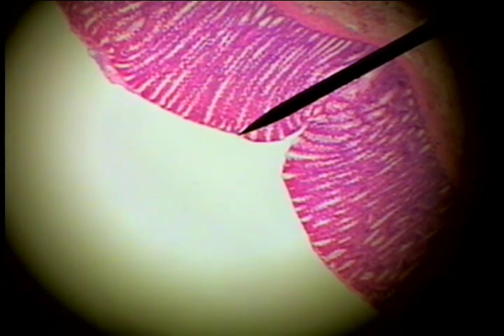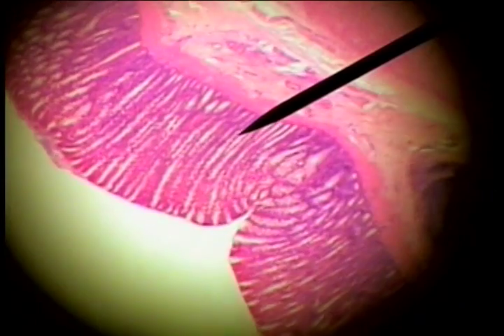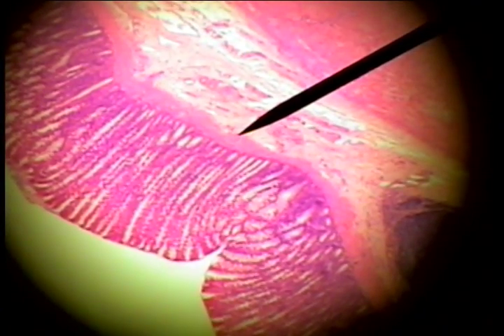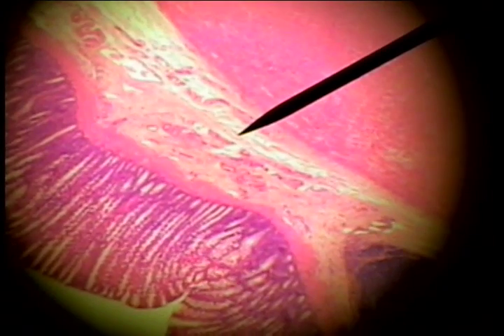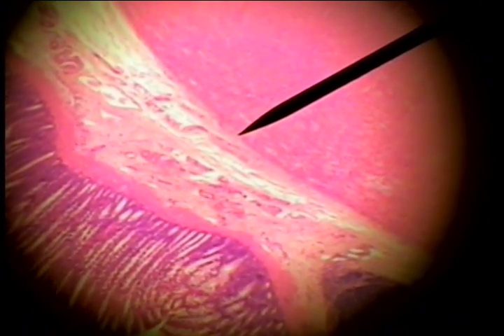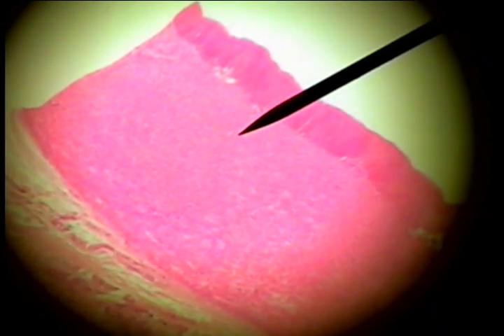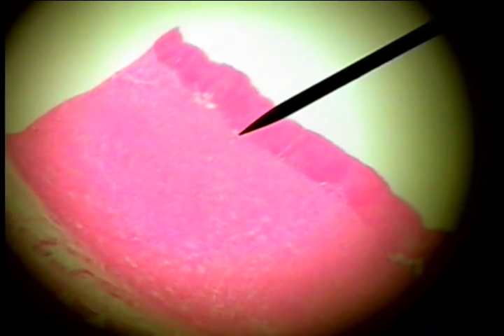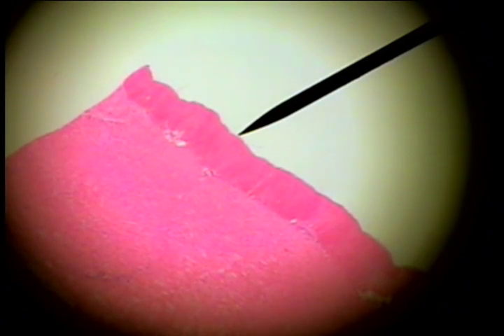The large intestine or colon is characterized by a mucosa, a submucosal layer with the blood vessels, arteries, nerves, the thick muscularis externa of a longitudinal and cross-section of smooth muscle, and the outer serosal layer.